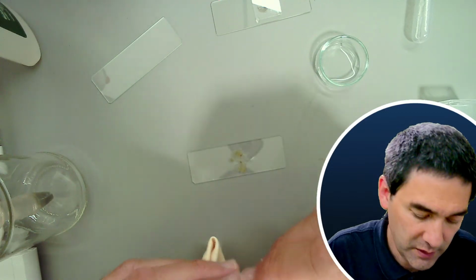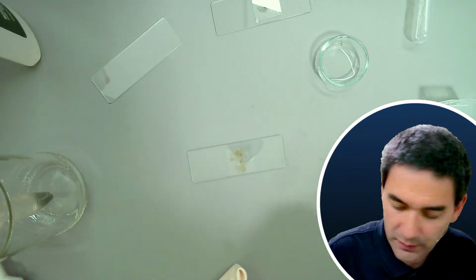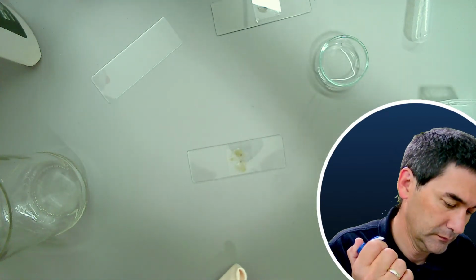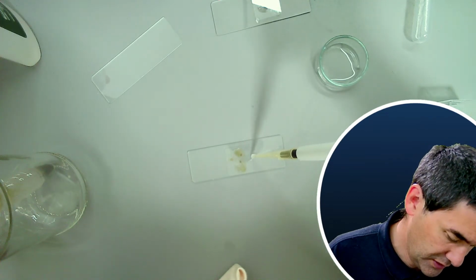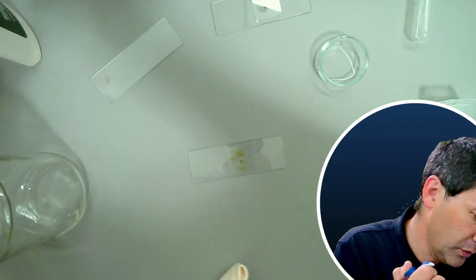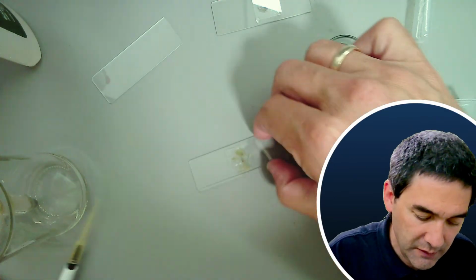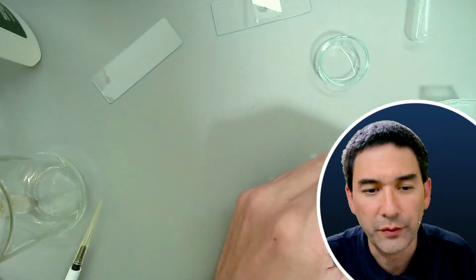So let's give this a try. I think we do need a little more water here. And I've also taken out some of the worms and transferred them to a different container, because I want to see if they're reproducing. So I've been also feeding them a little bit. Okay, but let's have a look at this here, just for the fun of it.